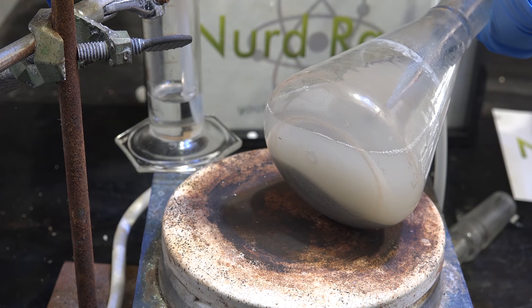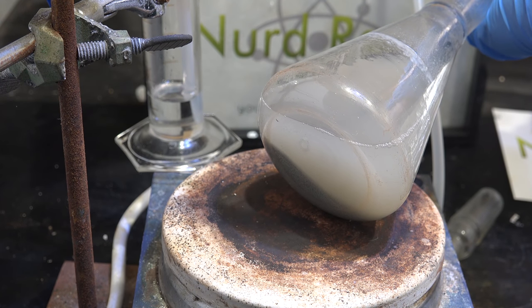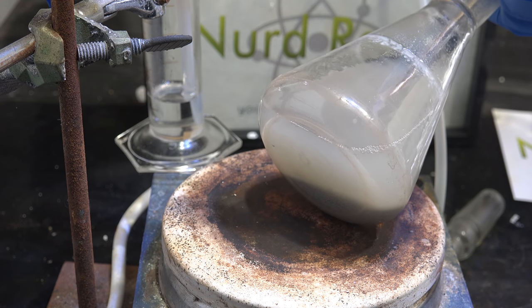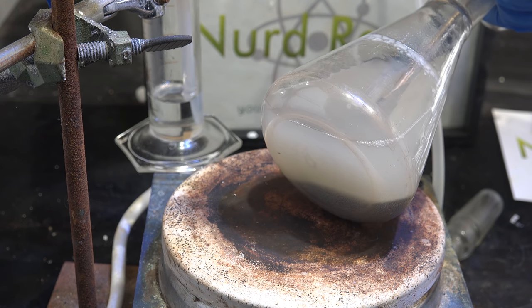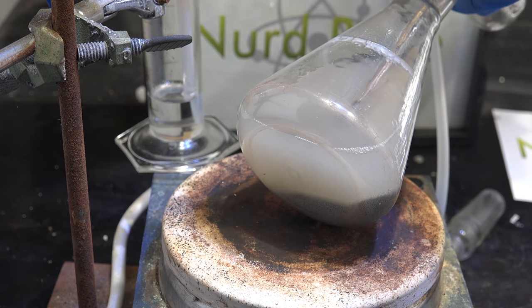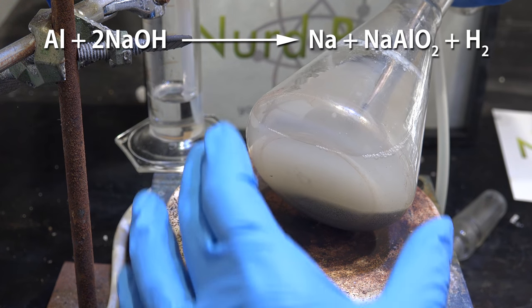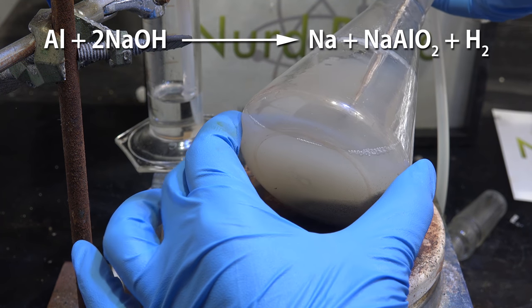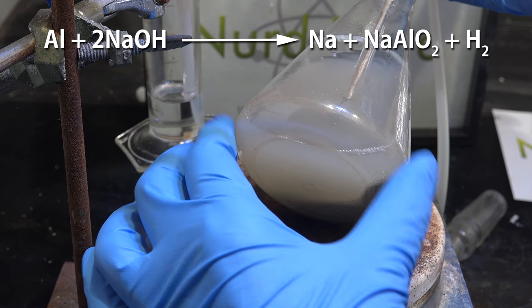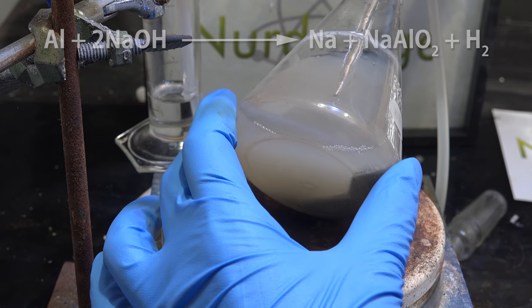And here it is after 8 hours and allowing it to cool down. Looks good, maybe it worked this time. On a different note it doesn't seem like we're making sodium with just aluminum. In theory it should be possible to make sodium from aluminum but it doesn't seem we have the right catalyst or temperature to make it happen. Oh well.